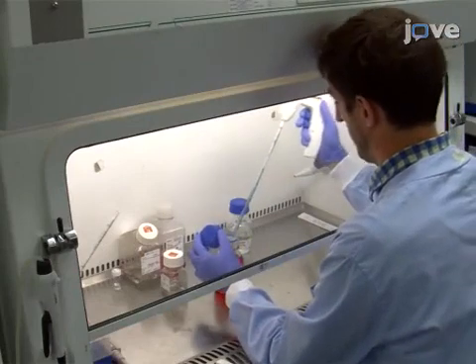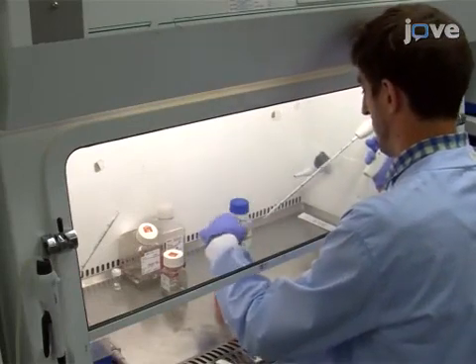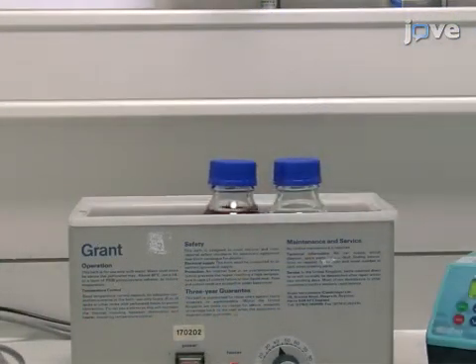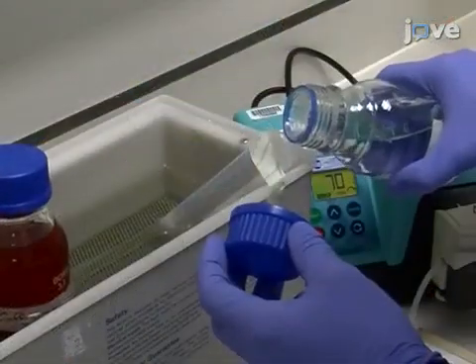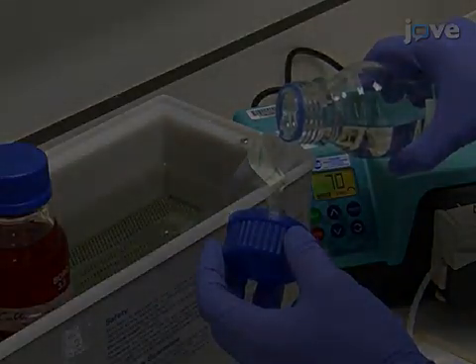After freshly preparing all reagents listed in the table of materials and reagents found with the accompanying text protocol, warm the EGTA-HBSS solution and the collagenase solution at 40 degrees Celsius for 30 minutes. Use 70% ethanol to rinse the pump flexible tubing. Then pour 40 milliliters of EGTA-HBSS solution into a centrifuge tube immersed in the water bath.